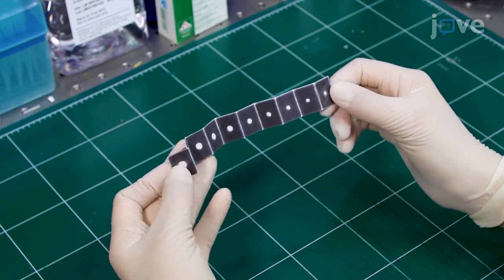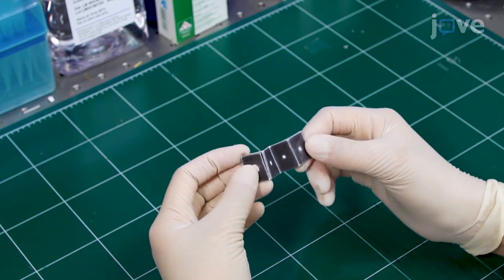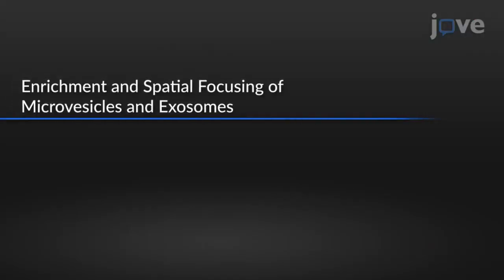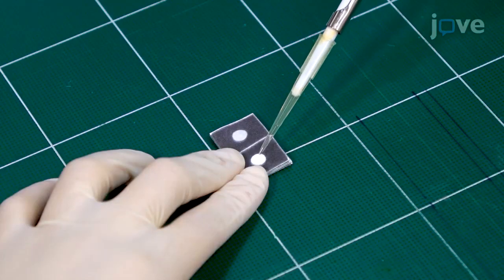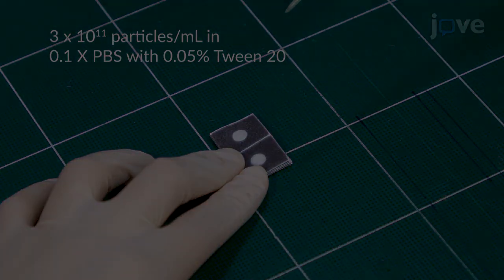Fold the ExoPad device back and forth along the white lines to convergently connect all sample areas. Pipette 15 microliters of the microvesicle and exosome sample in the convergent sample areas.